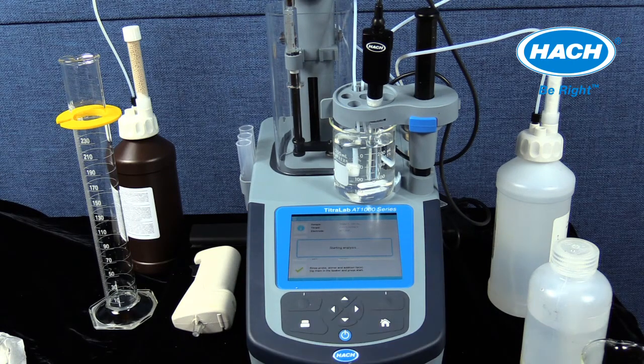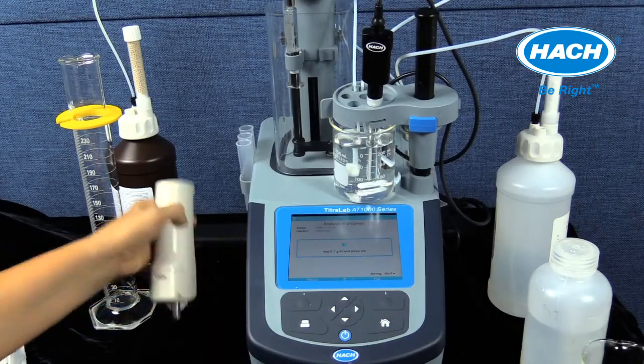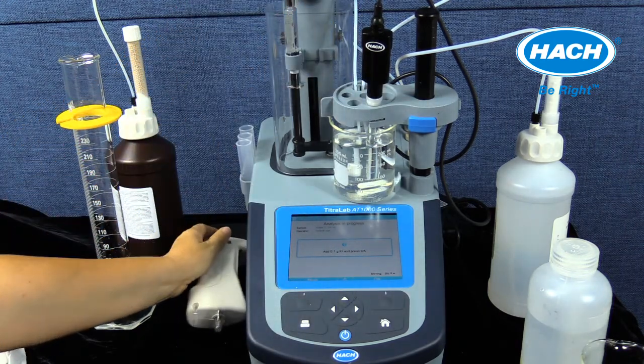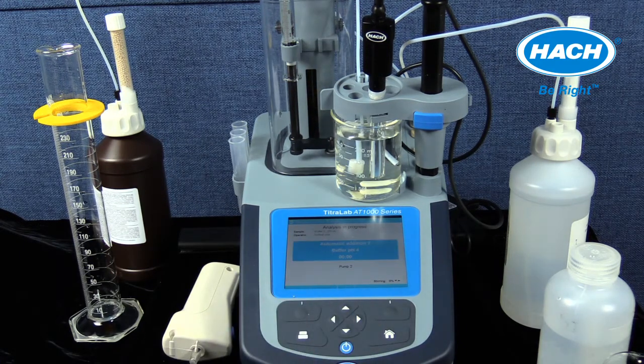The software will display that the analysis has started and then will prompt the addition of 0.1 gram of potassium iodide. For other applications, the software would prompt the addition of a different reagent or a different action to take place before starting. In this training example, the Swift test is an easy way to add this volume of potassium iodide to the sample by pushing the black button on the dispenser. After the reagent powder is added, select OK on the screen.